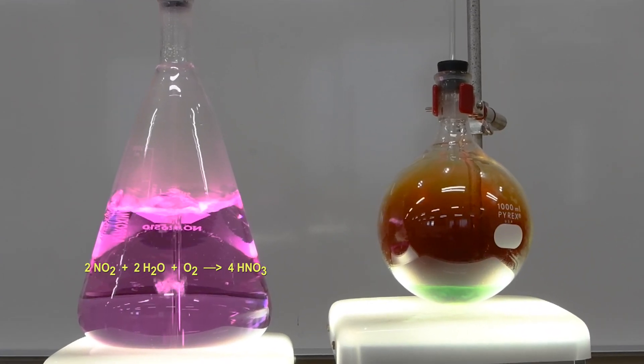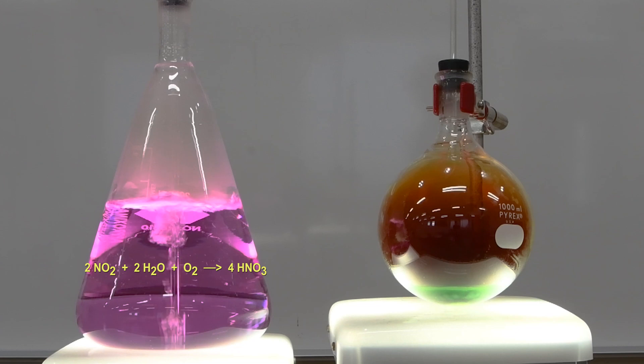And if you remember, what does phenolphthalein do in an acidic solution? Well, you're going to see in a moment here.